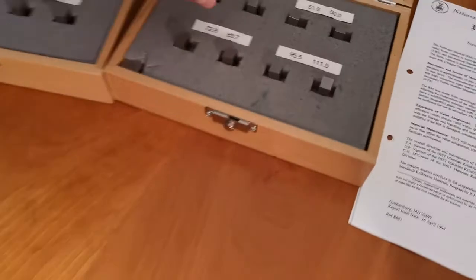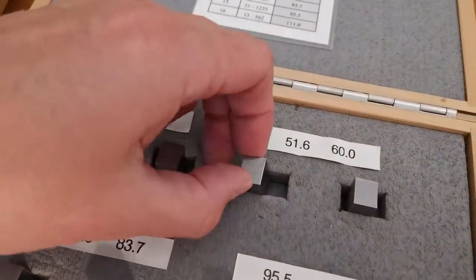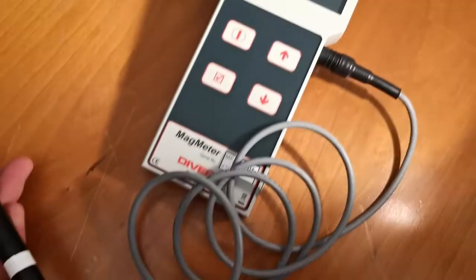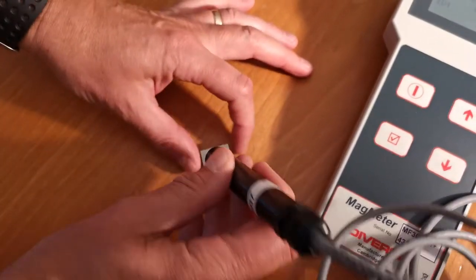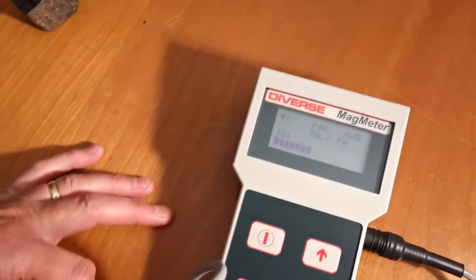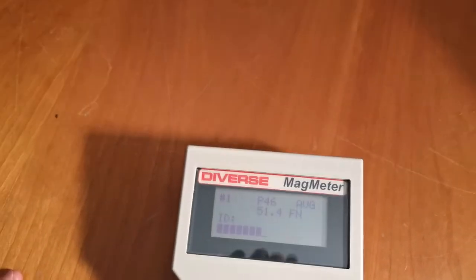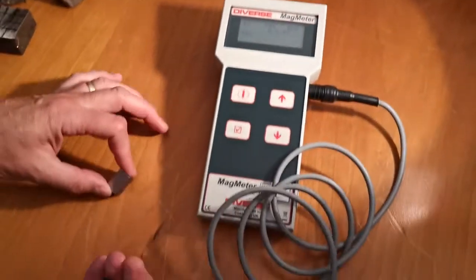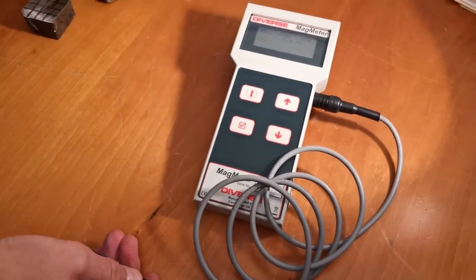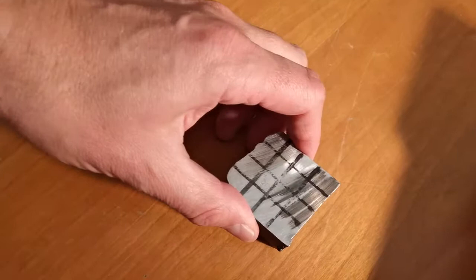The meter has now detected the P46 probe and is ready for action. We'll now measure the 51.6FN NIST standard. Switching to some real world samples, we will measure these using peak mode.